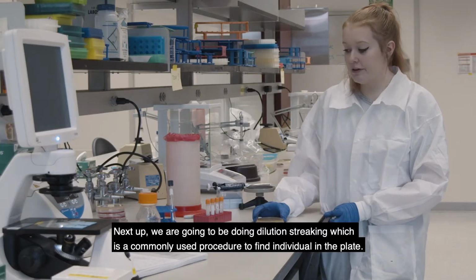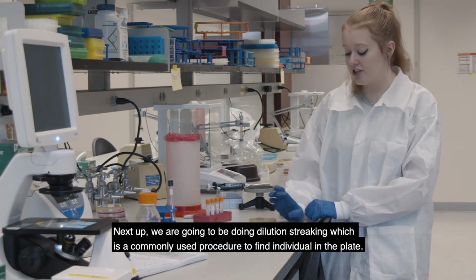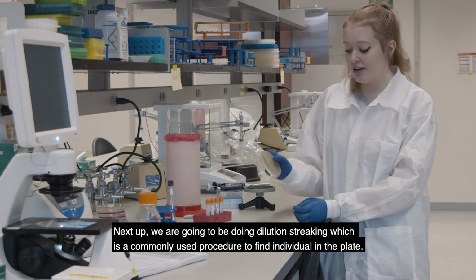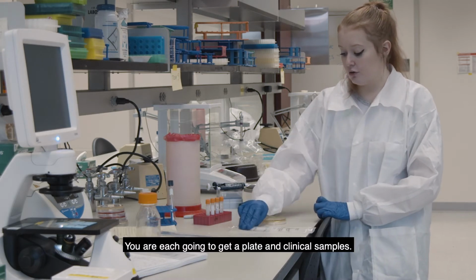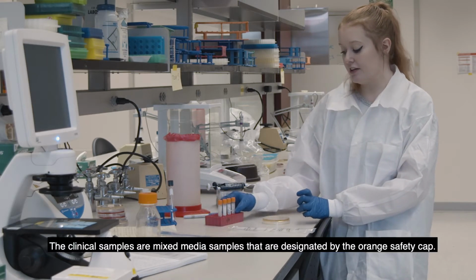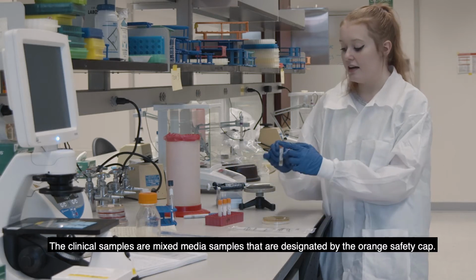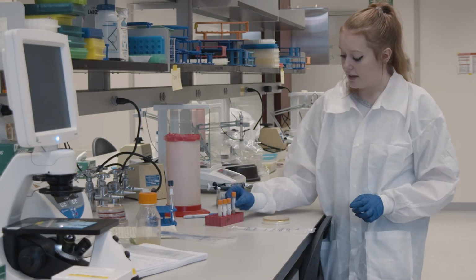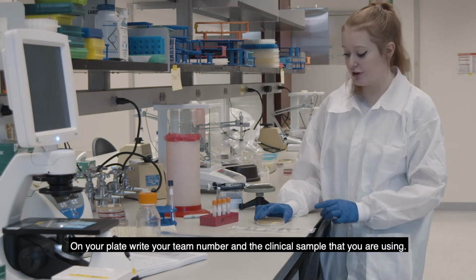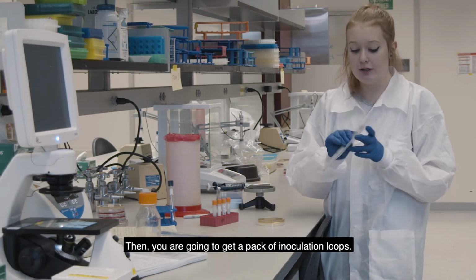So next up, we're going to be doing dilution streaking, which is a commonly used procedure to find individual bacteria in a plate. So you're each going to get a plate and clinical samples. The clinical samples are mixed media samples that are designated by the orange safety cap. On your plate, you want to write your team number and the clinical sample that you're using. And then you're going to get a pack of inoculation loops.